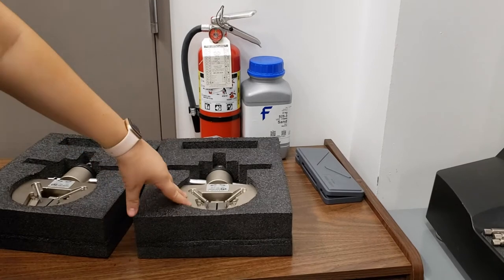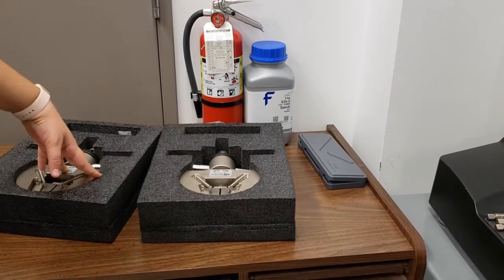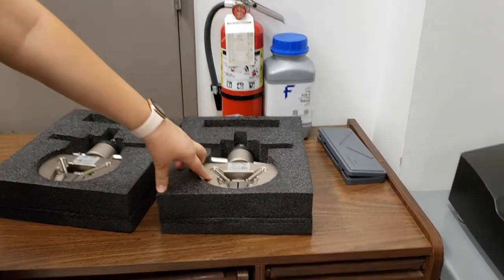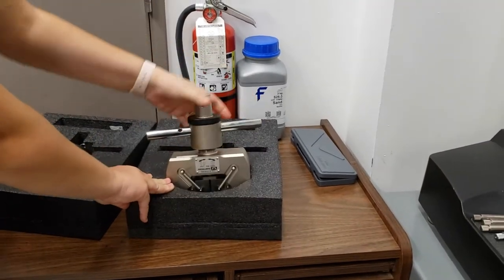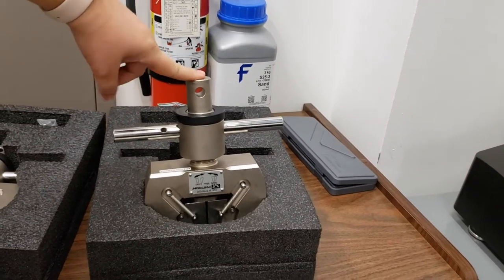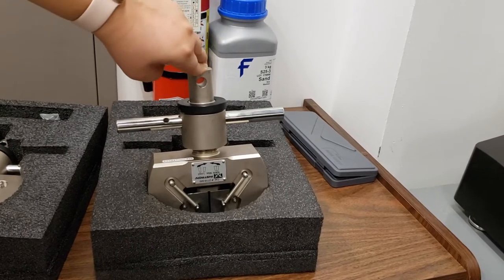These are what are called wedge action tension grips. Wedge action means that as it puts tension on your sample, it pulls a little bit tighter. These are meant for dog bone shaped materials and they can go all the way up to a 50-kilonewton maximum load — we have used these on metal dog bones as well. You can see this has an attachment that fits nicely to the 50-kilonewton cell. If you are set on using the 1-kilonewton cell for low load applications, you would need to use an adapter between this grip and the 1-kilonewton cell in order to attach it.